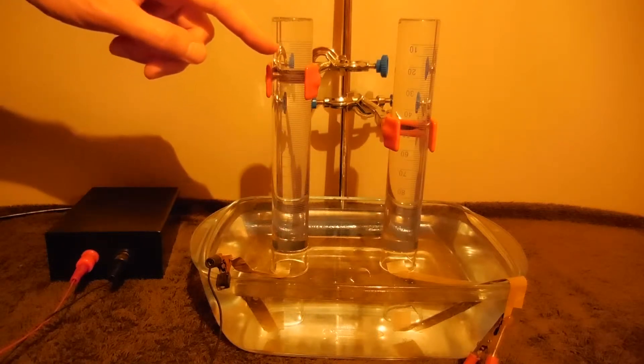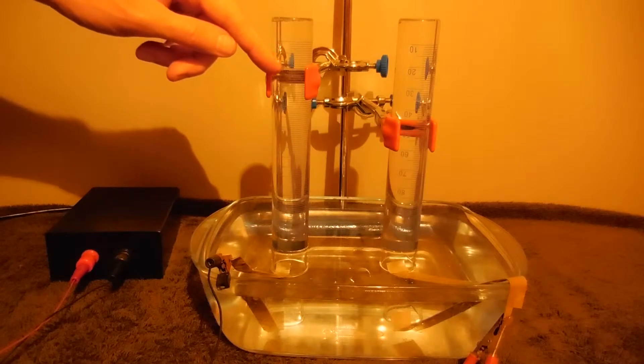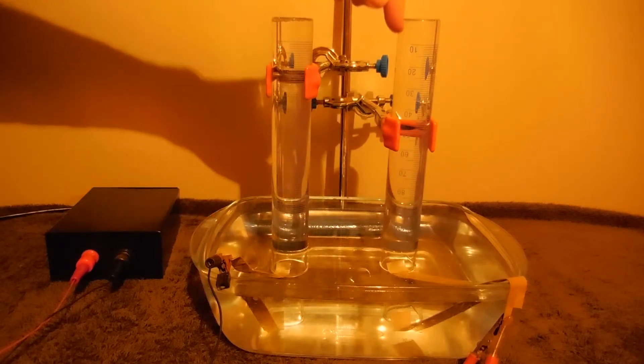In the left graduated cylinder there will be collected hydrogen gas. In the right cylinder there will be collected a very little amount of oxygen.